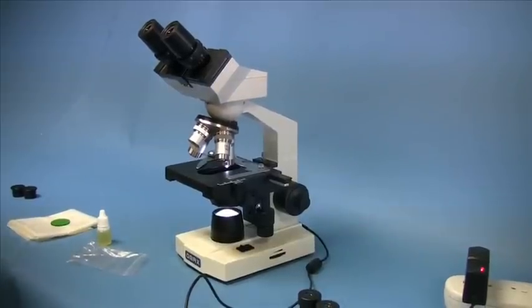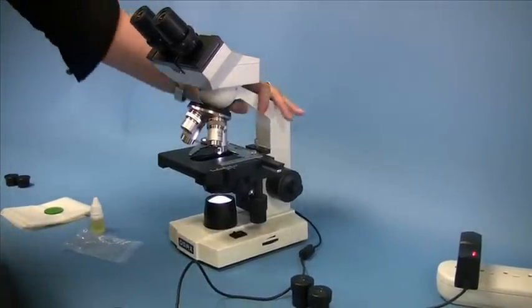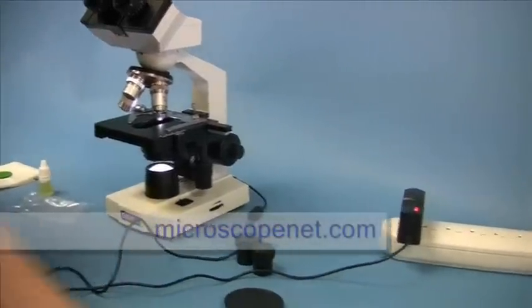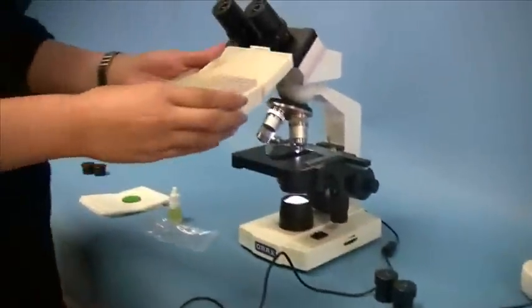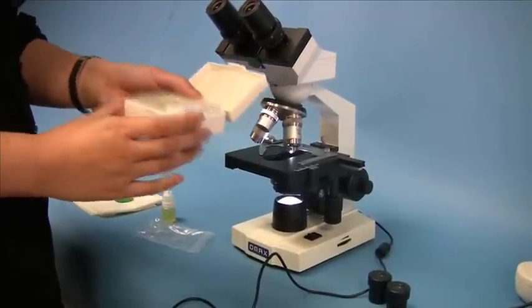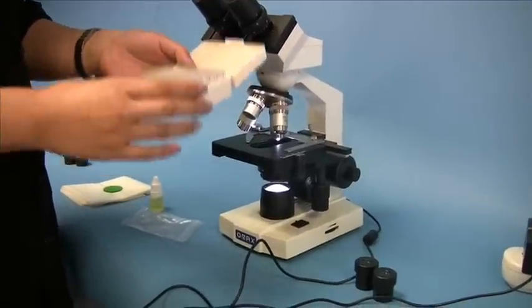Before using the microscope, you need to make some adjustments. So before doing that, let's start with placing the specimen on the stage. Usually you want to use a slide that is not included in the package of the microscope, but you can purchase them separately.